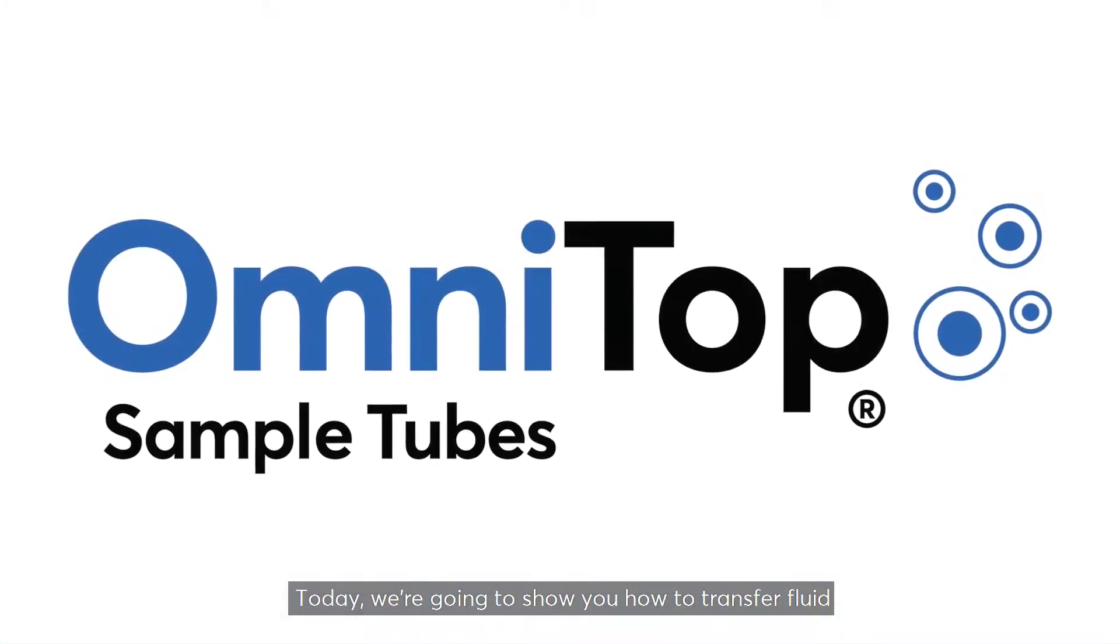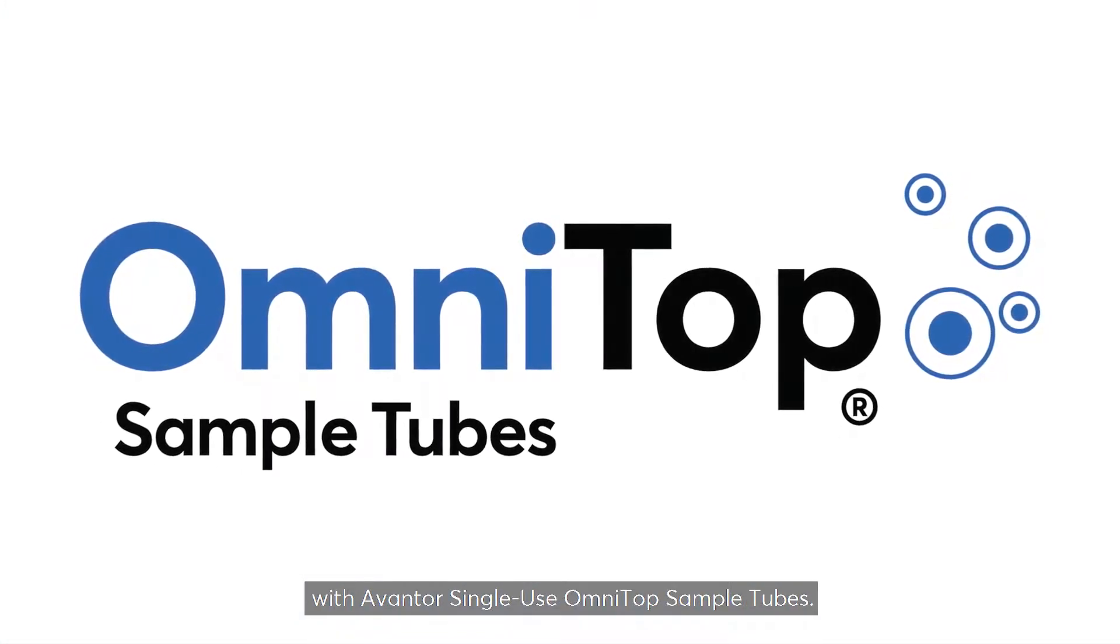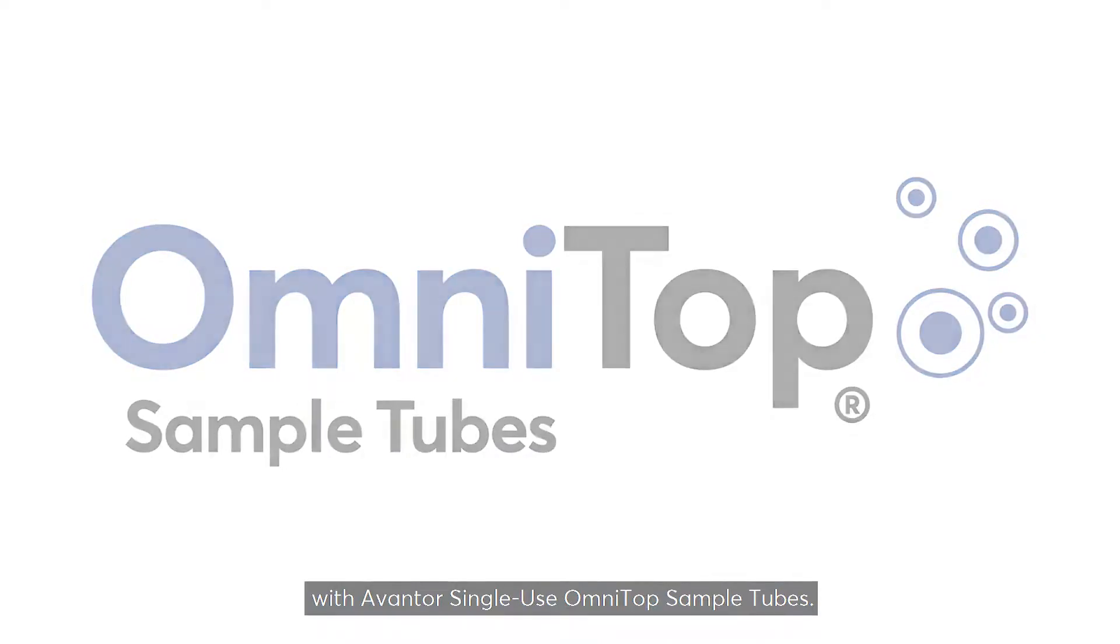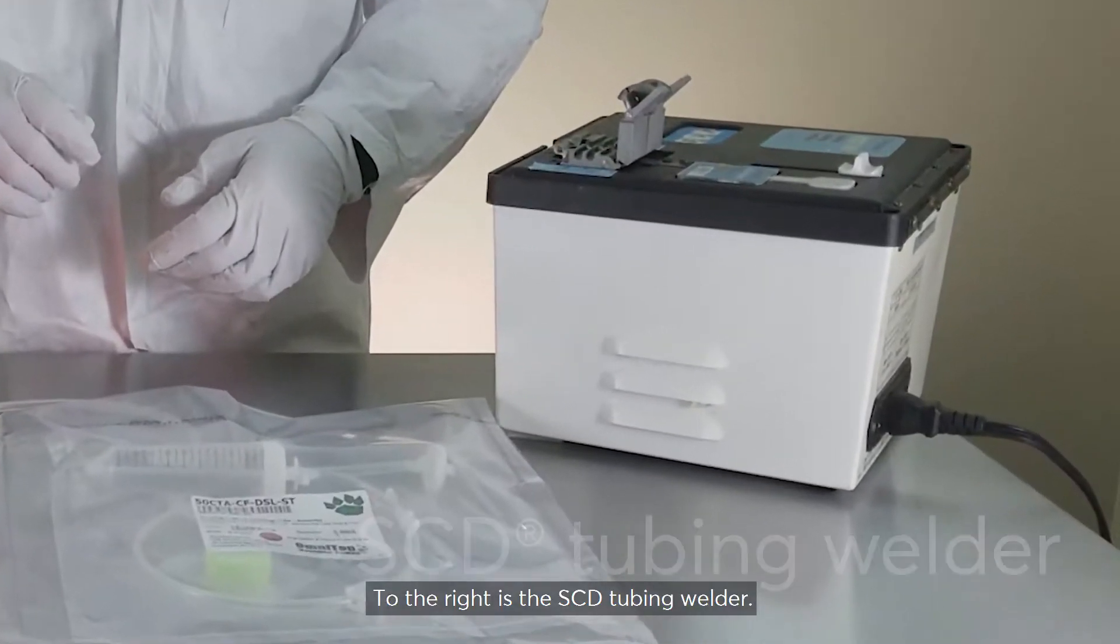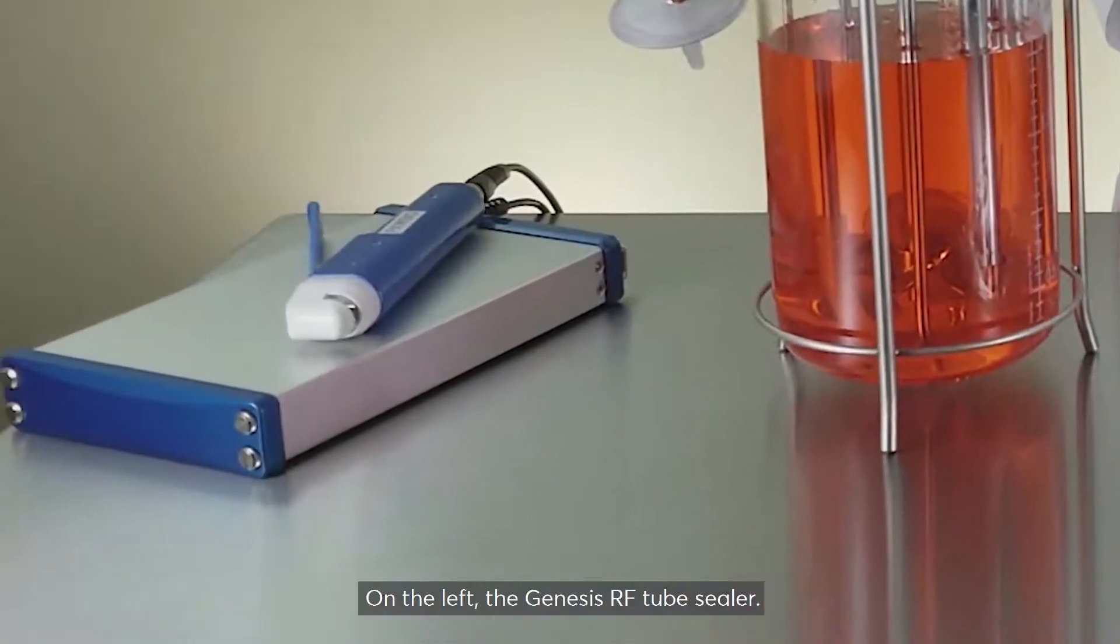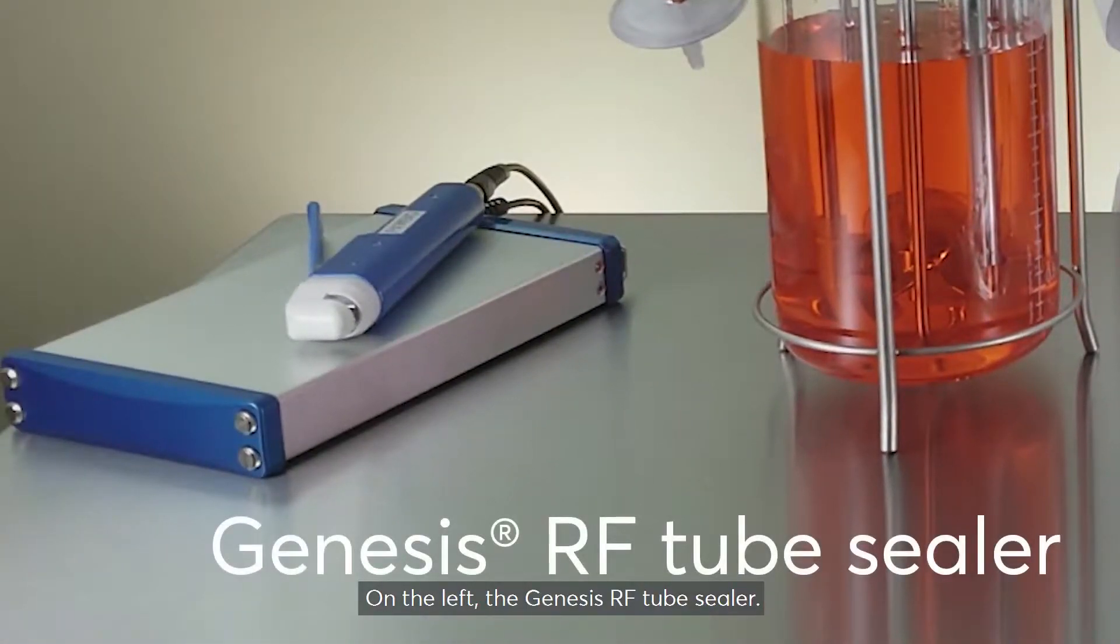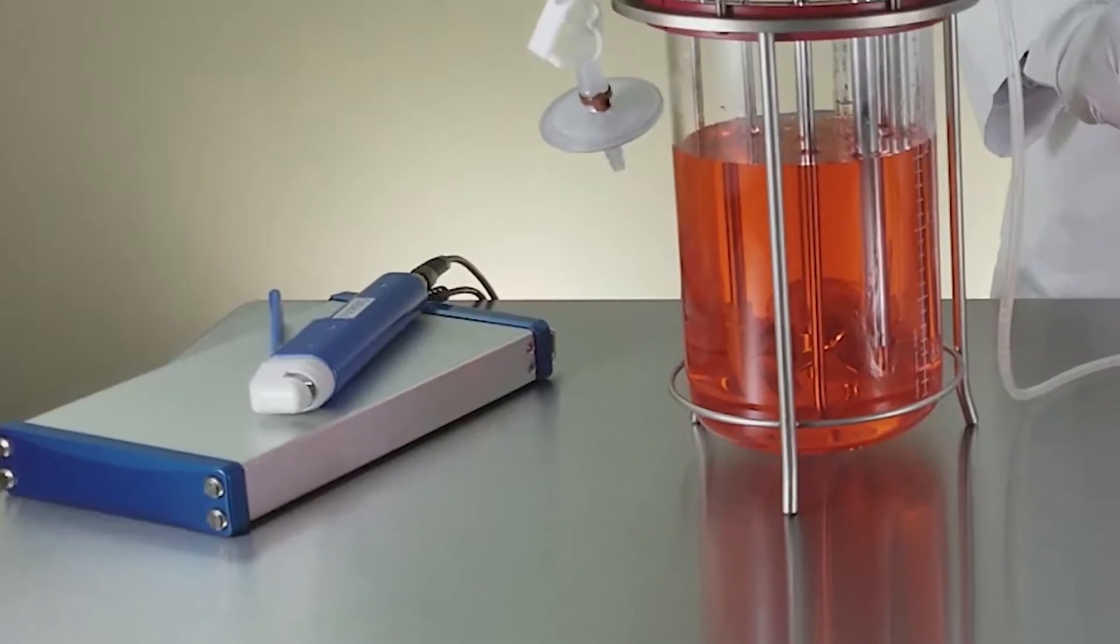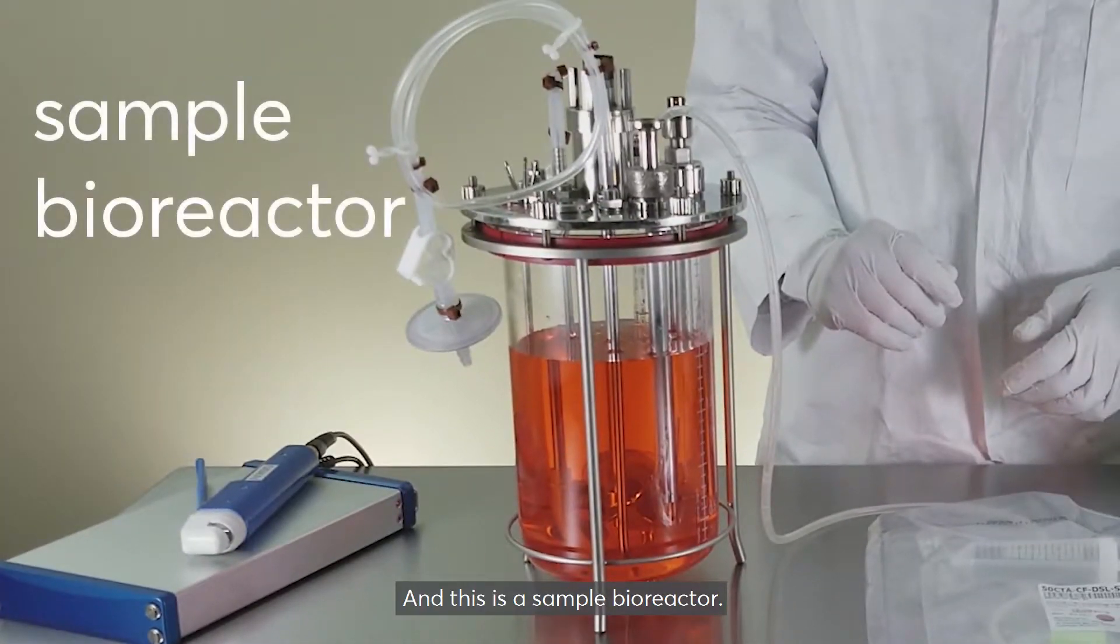Today we're going to show you how to transfer fluid with Avantor single-use OmniTop sample tubes. To the right is the SCD tubing welder, on the left the Genesis RF tube sealer, and this is a sample bioreactor.